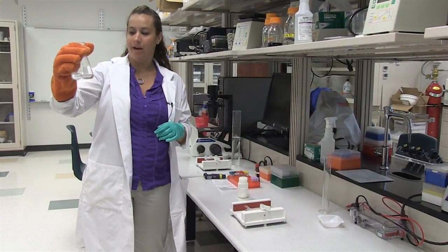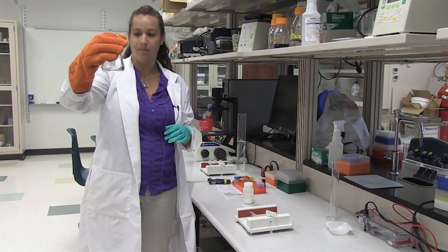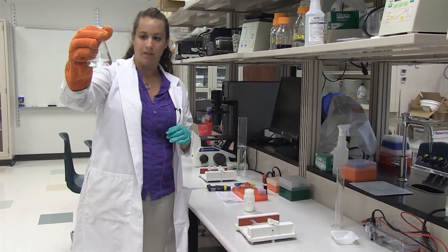So now that we've come back from the microwave you can see that the agarose is nice and clear. That's our sign that the agarose has dissolved in our buffer.